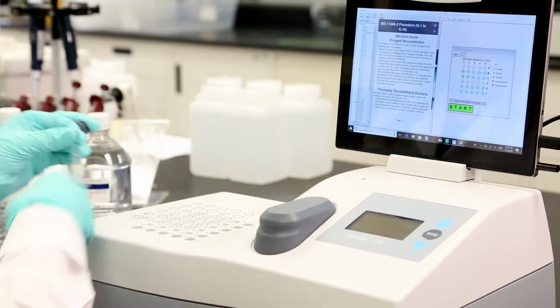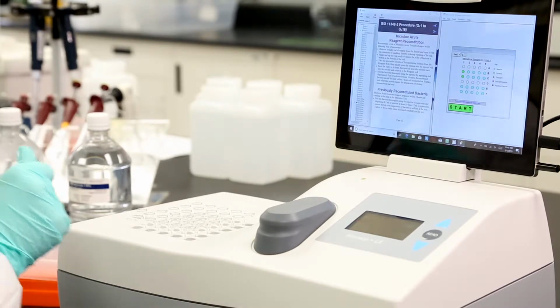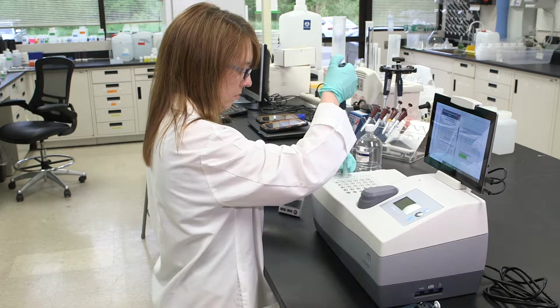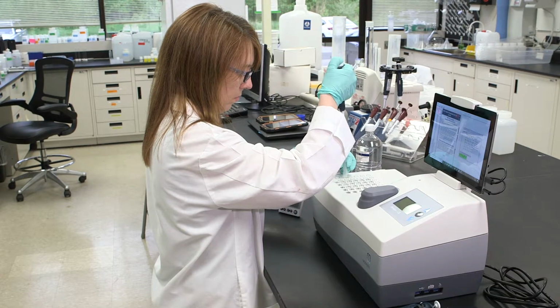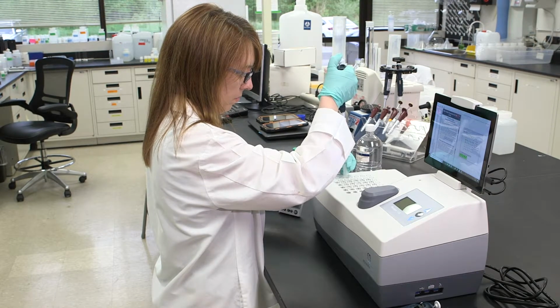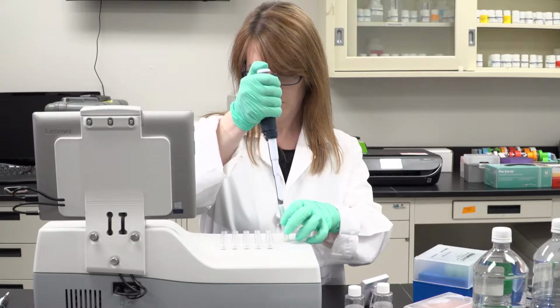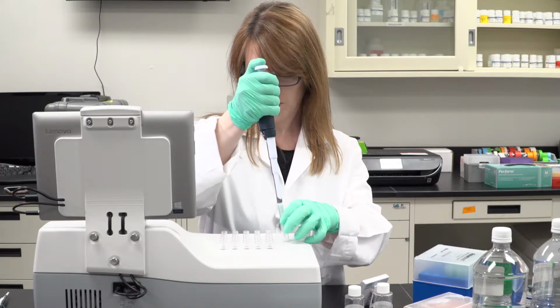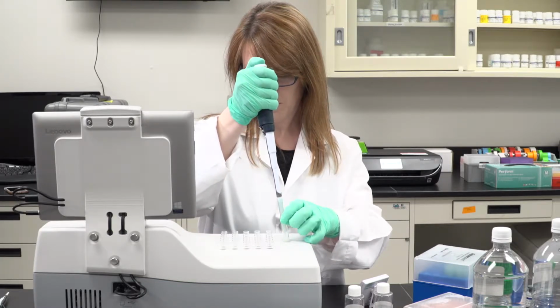Swirl the vial 3 or 4 times, then quickly pour the mixture back into the cuvette and return it to the reagent well. Mix the bacteria thoroughly using the pipetter by aspirating and dispensing 0.5 milliliters of solution at least 10 times. Reconstituted bacteria should be used within 3 hours of reconstitution. Further tests after this period require the preparation of freshly reconstituted bacteria.